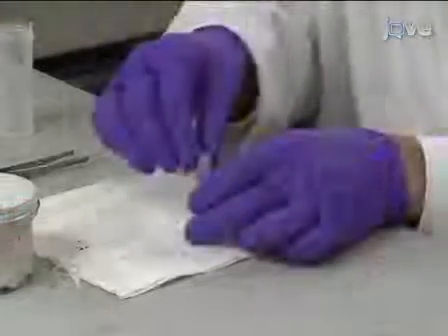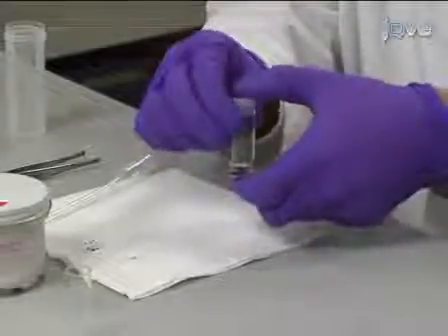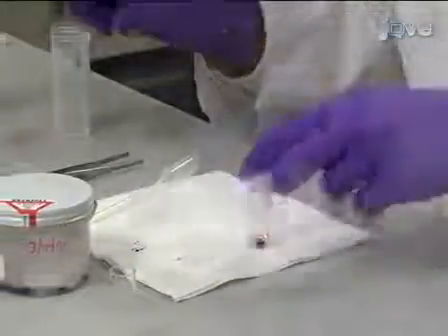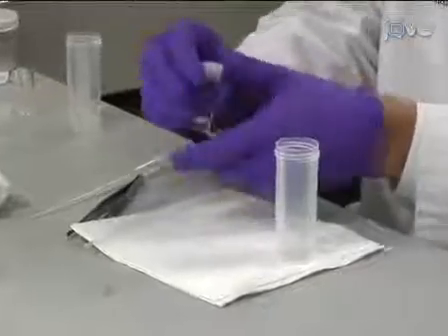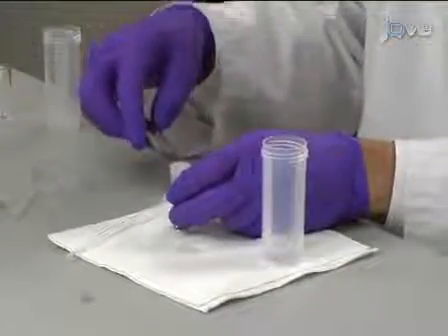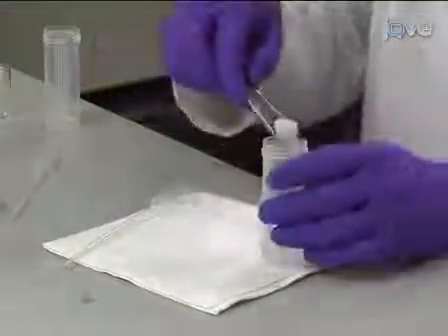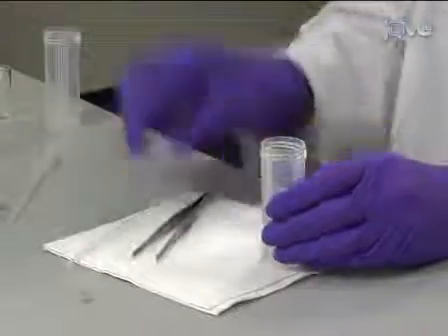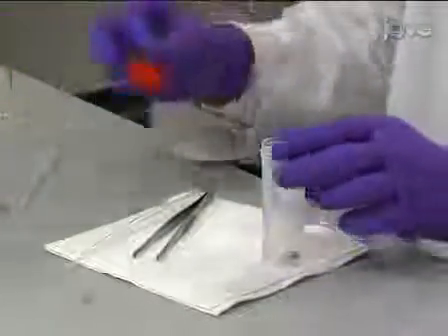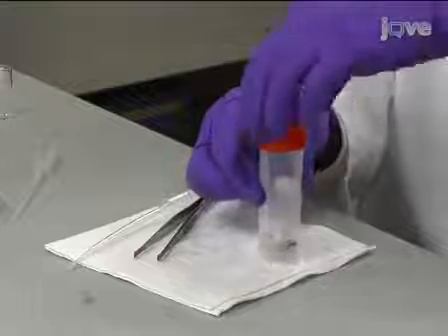Proceed immediately to adding about 2.5 milliliters of warm water at 45 degrees Celsius to the carrier plastic tube. Then insert the capped glass tube containing the cells, the AV marker and the histogel. Working quickly and using warm water prevents the gel from solidifying during subsequent steps.